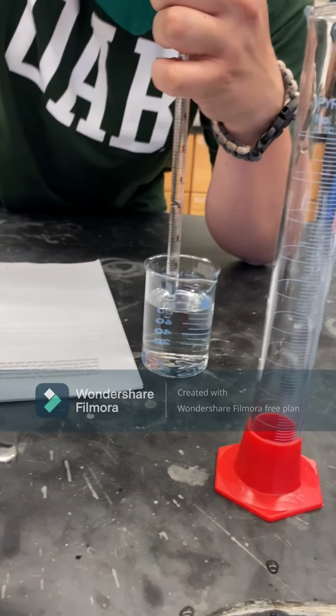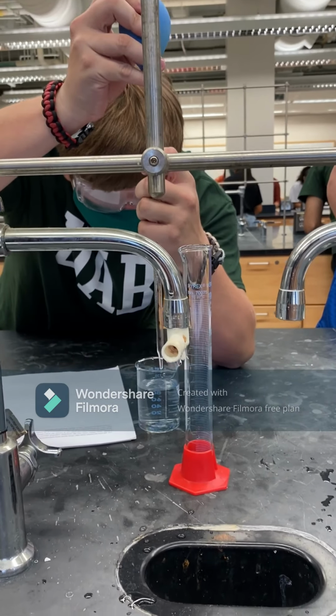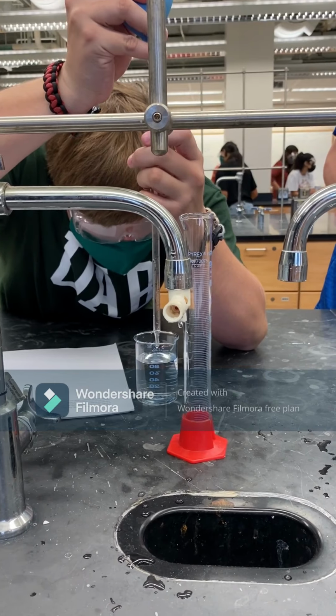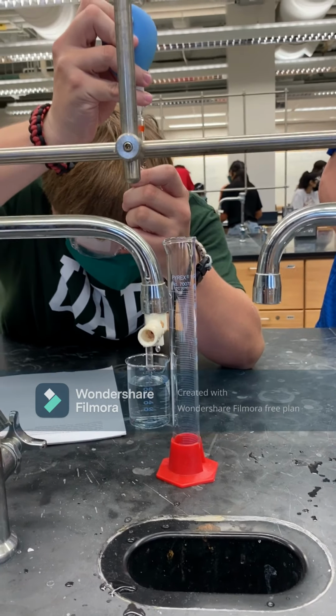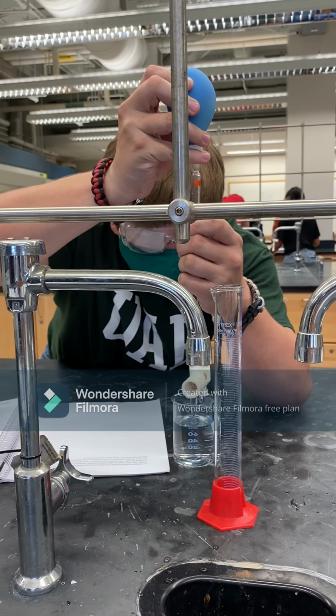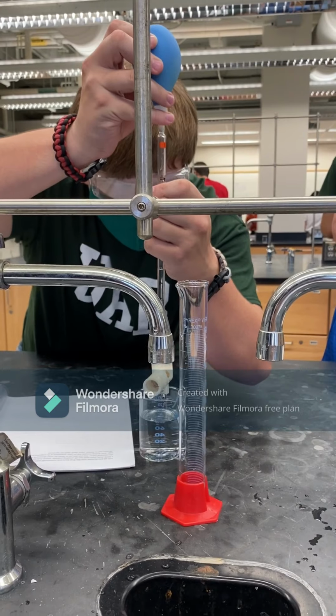Here is the student wearing proper lab attire: lab goggles, a sleeved shirt, and some sort of clothing that covers all of the legs, and shoes, demonstrating how to use a pipette in order to transfer solutions. As seen in the graduated beaker, the student placed the stock solution there and is not taking the solution straight out of the stock container.